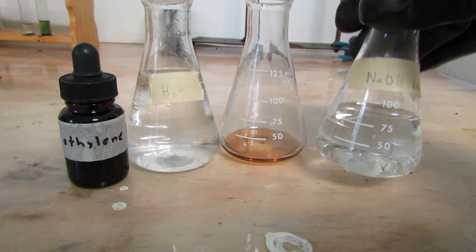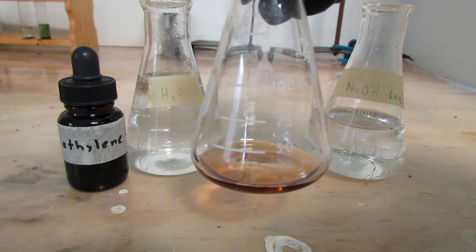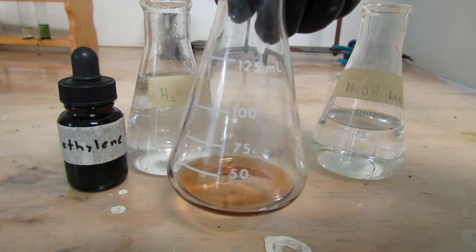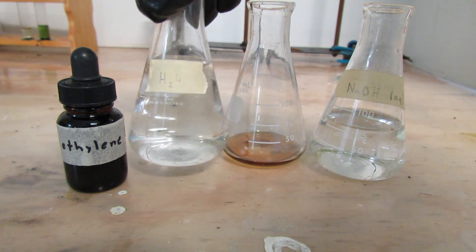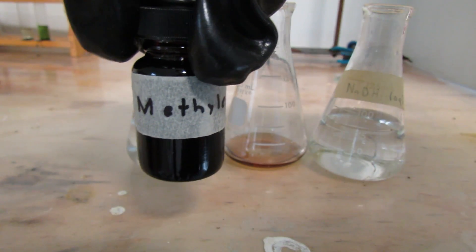For this reaction you're going to need sodium hydroxide solution, 5 milliliters of syrup, distilled water, and methylene blue. Be careful with this stuff because it stains everything.